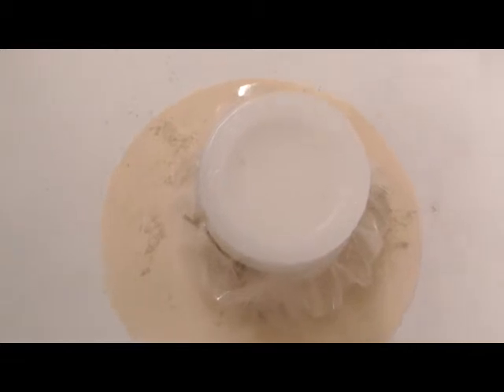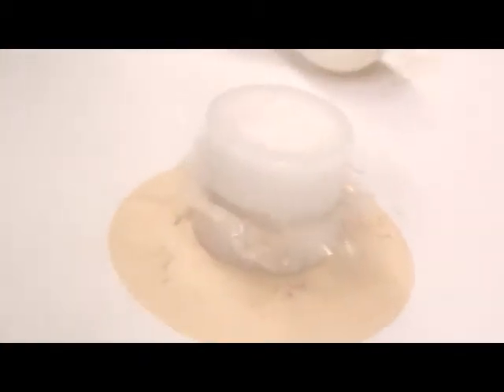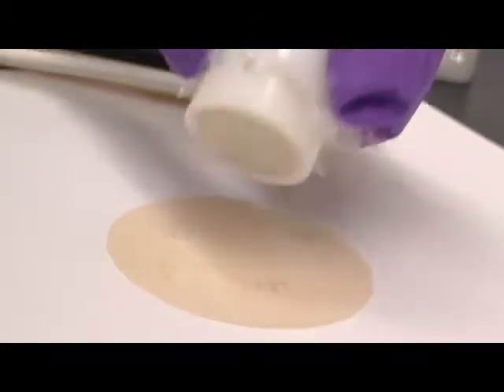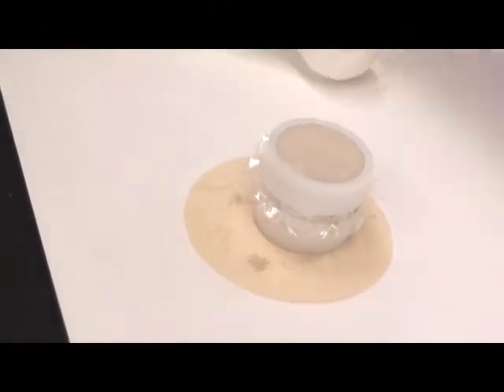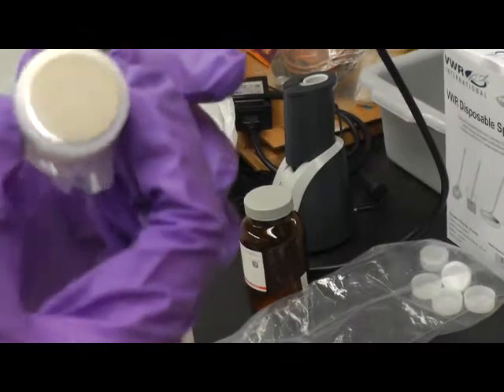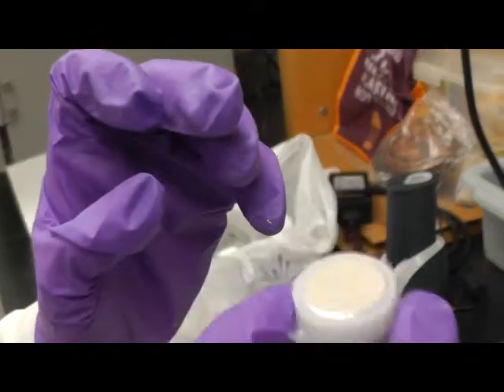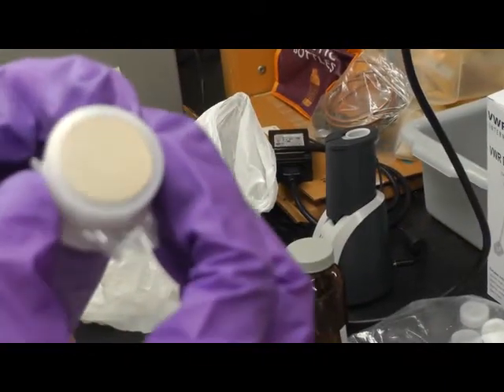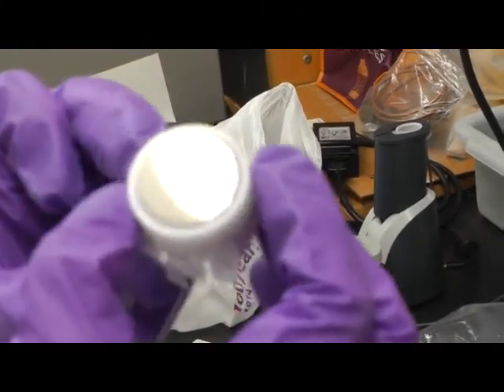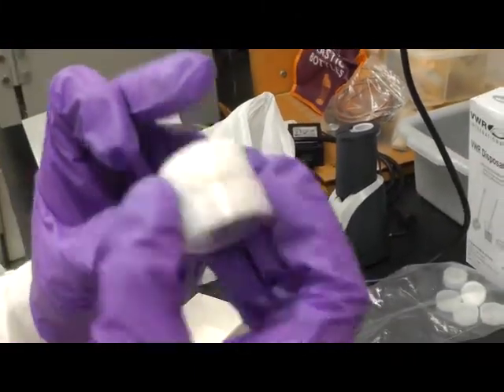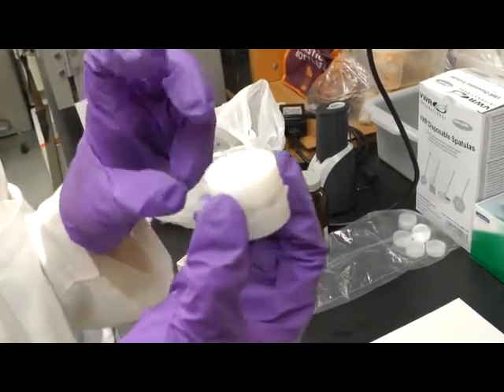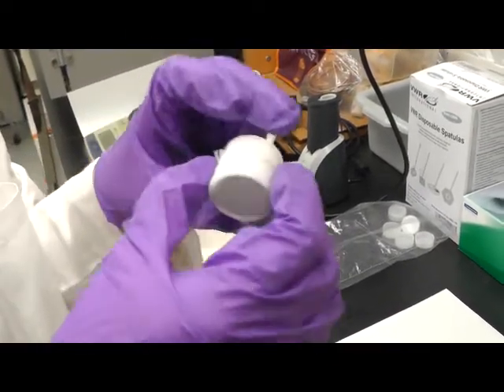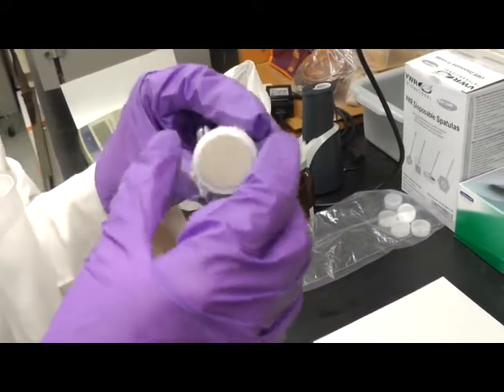So here is a completed XRF cup with soil samples inside. And the last step, please check this surface. It should be a flat surface. If you can see that the soil sample inside, there is still some empty space between soil particles. It is because there is not enough stuffing put on the top. So please remake another one.